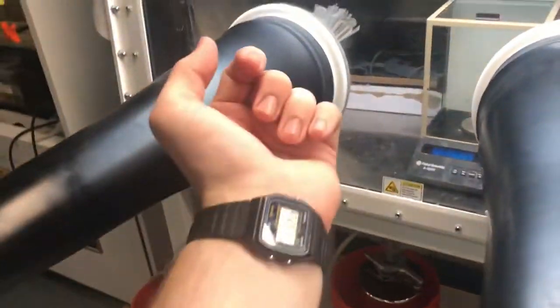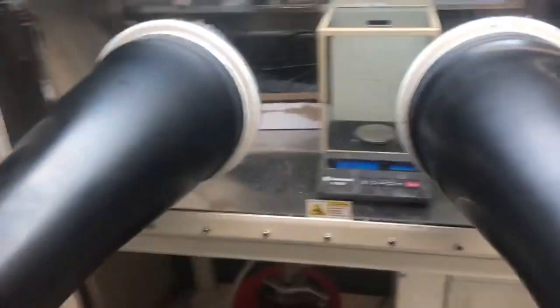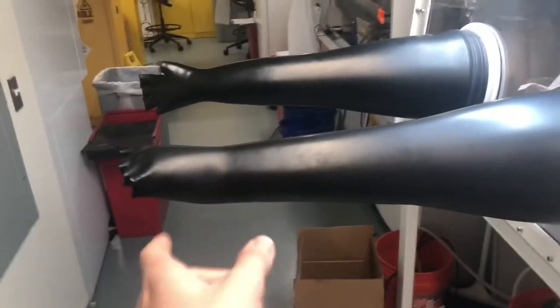Now, before going into the glove box, you need to remove anything on your wrist. You can't have bracelets. You can't have watches. You need to take them off. You put on a pair of nitrile gloves. And after you put on a pair of nitrile gloves, you put on a pair of cotton gloves. These cotton gloves make it infinitely easier to put your arms into the glove box.